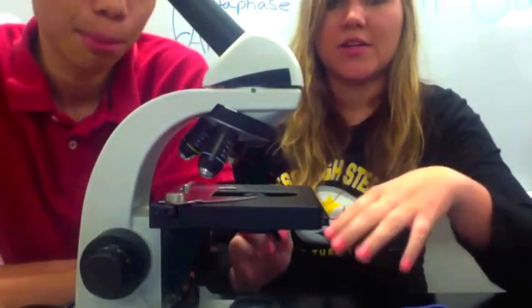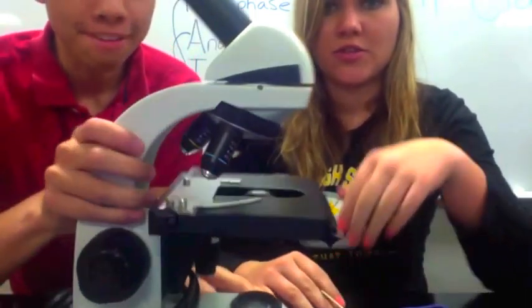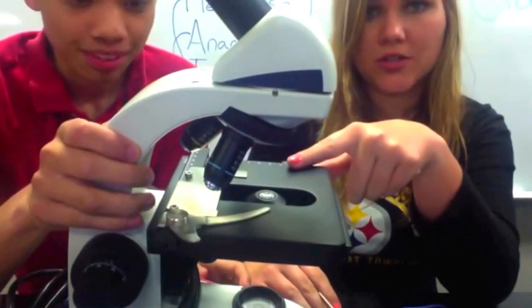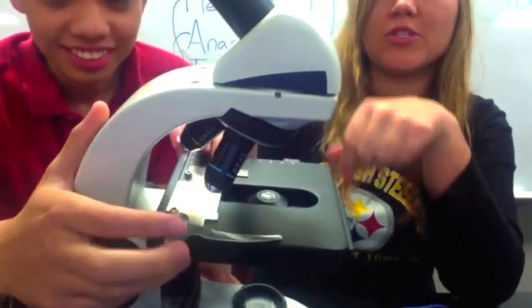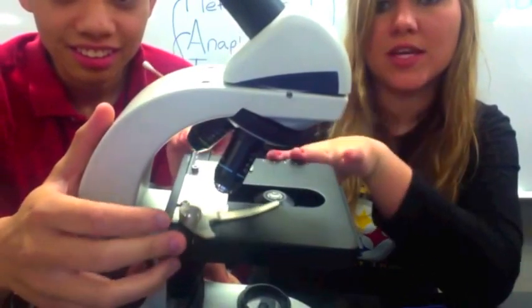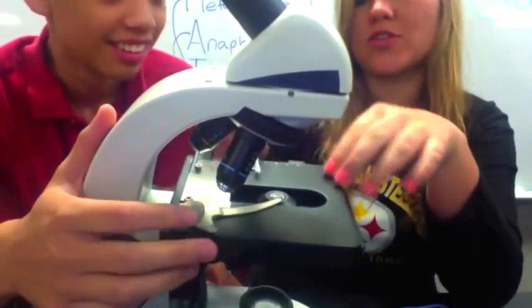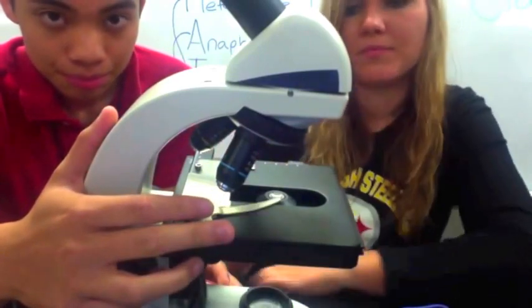The next part is your stage, and there are two parts to your stage. You have the black part, which is just your regular stage, and then you have the silver part, which is your mechanical stage. The mechanical stage is the one that actually moves, and it's also where you would secure your microscope slide.